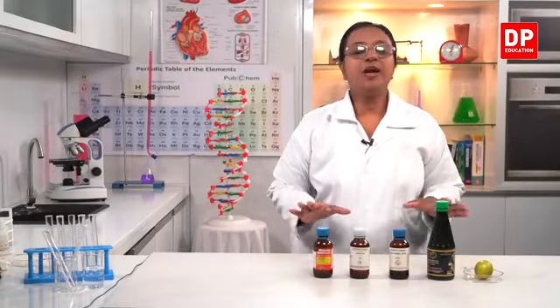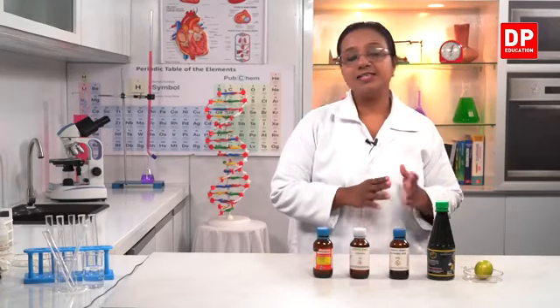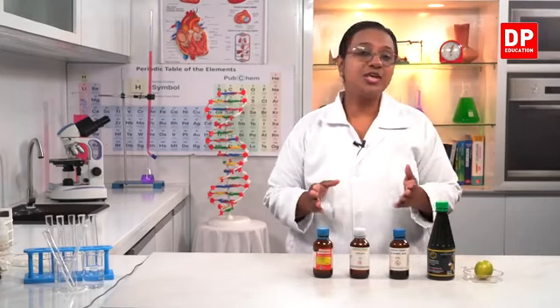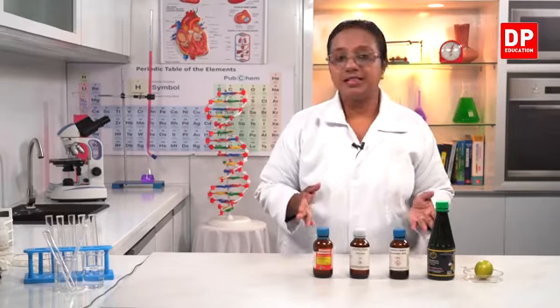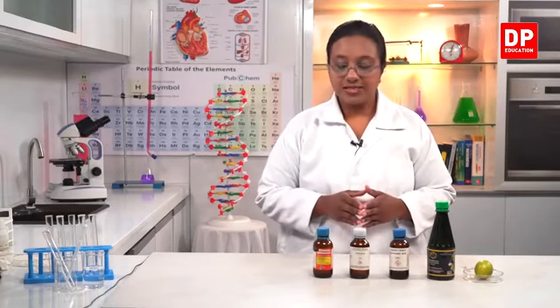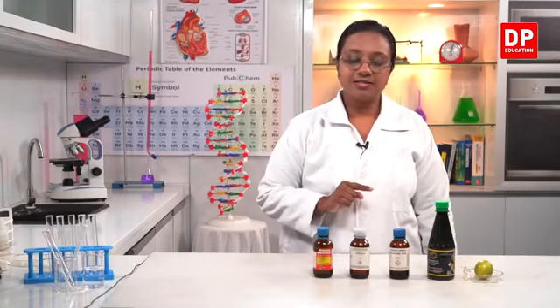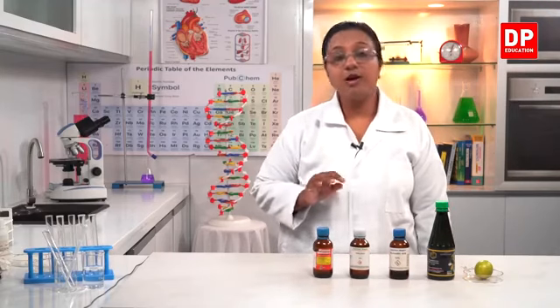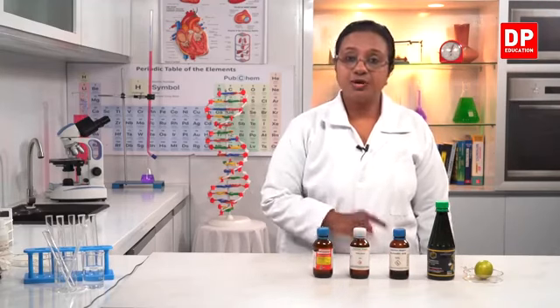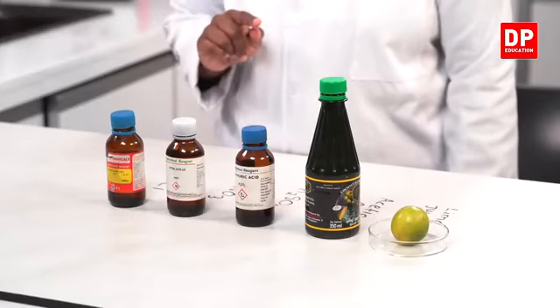Okay, students. So now we are going to observe the acids that are present in the lab as well as two acids that we use at home. So you all know what acids are? Substances that release H plus ions in the medium. And you know the examples. Now here you can see hydrochloric acid, then nitric acid as well as sulfuric acid. And you know the chemical formulae of all these acids. H2SO4 is sulfuric, HNO3 nitric and HCl is hydrochloric acid.